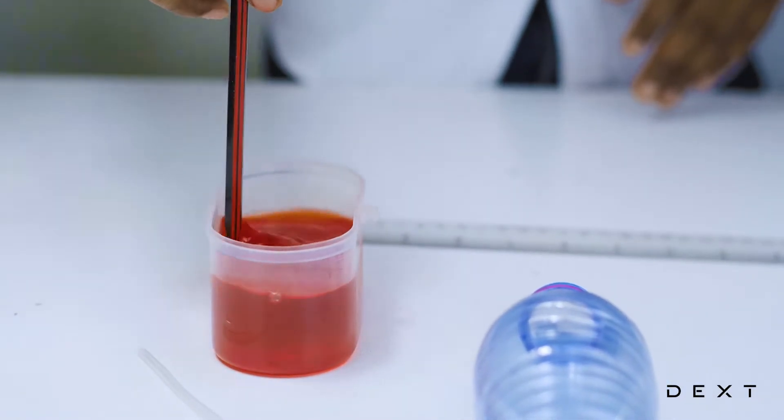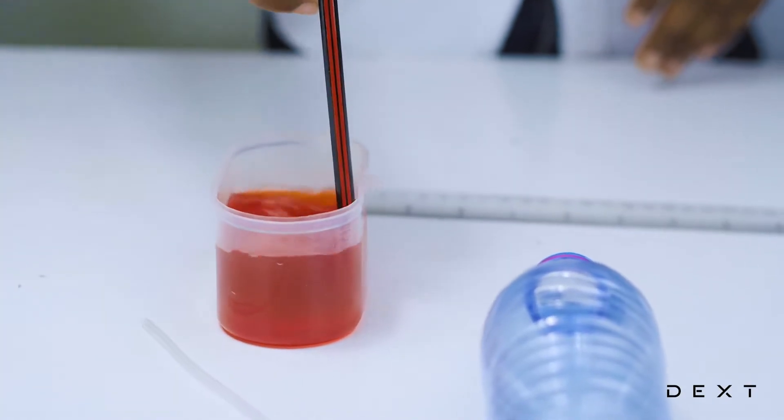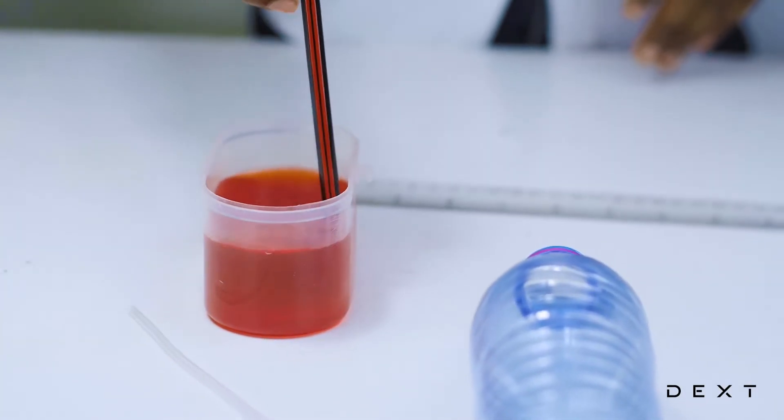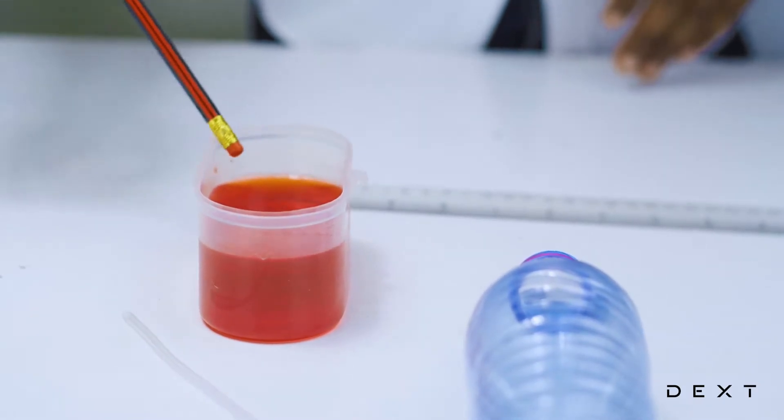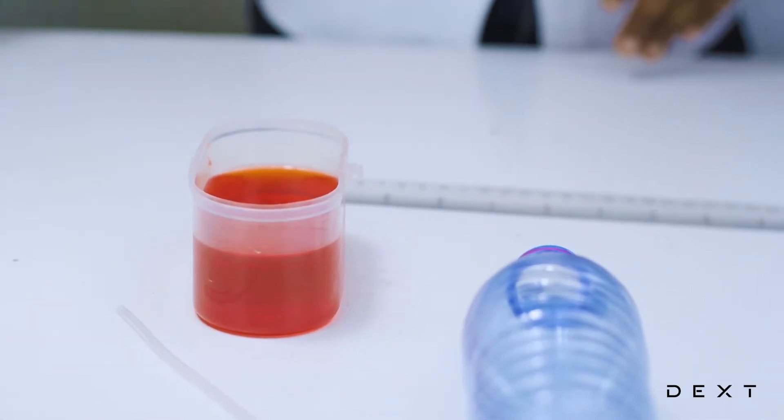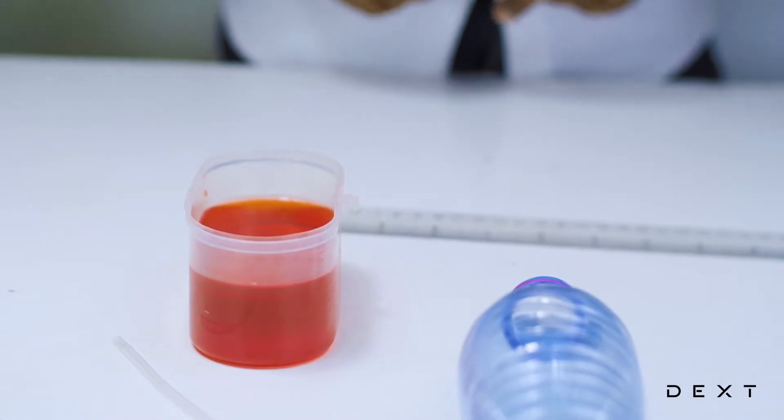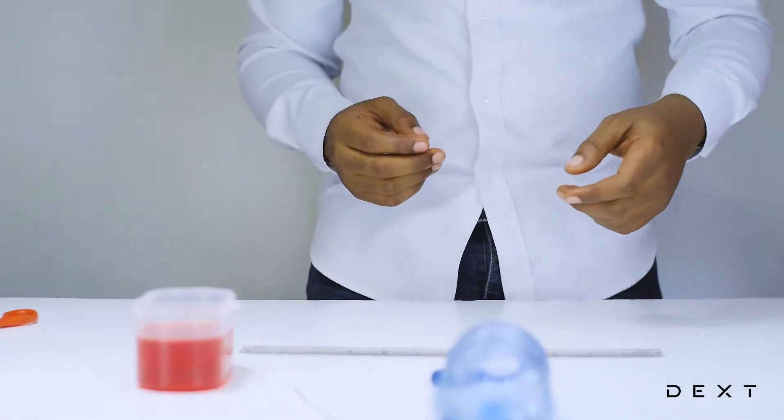Let's stir it with a pencil here. This is just to enable us to visualize the water as it rises to fill the space that was previously filled by the oxygen.